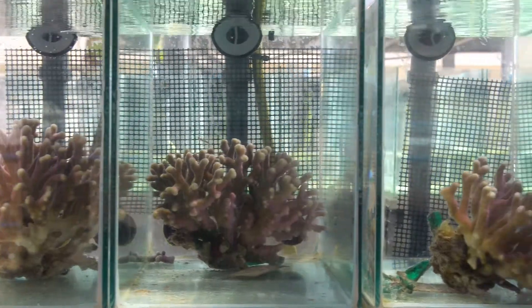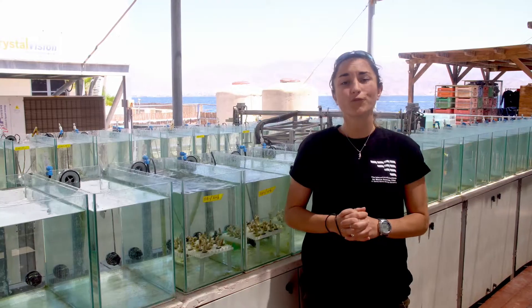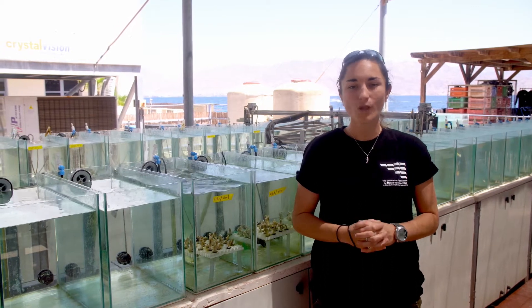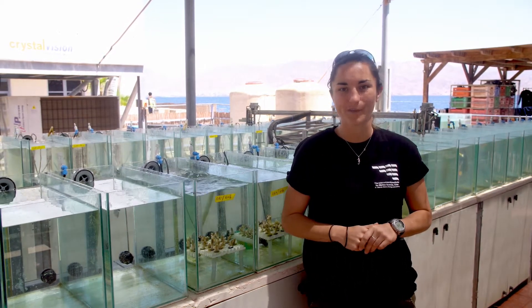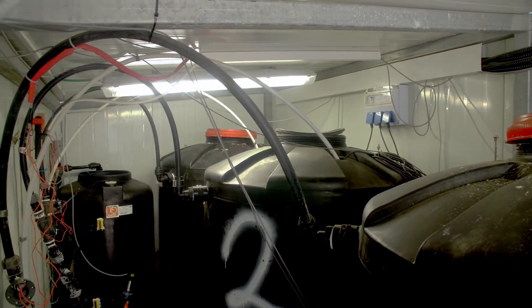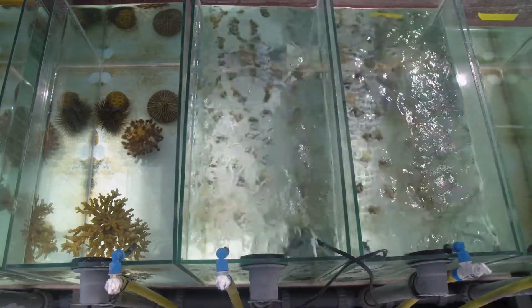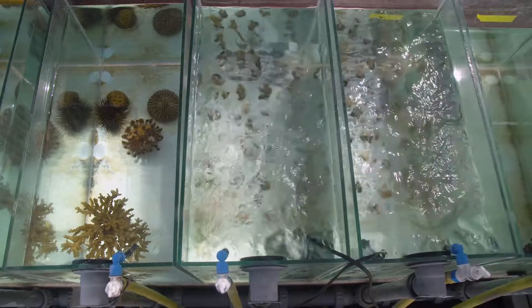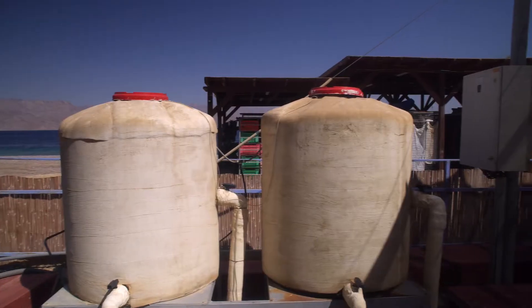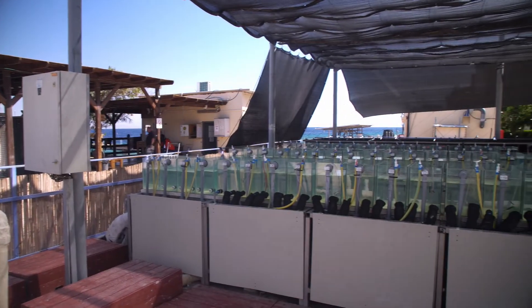In total, the system hosts 88 individually controlled experimental aquaria. Up to 4 pH treatments and 6 temperature treatments can be run in parallel. Water flows in directly from the adjacent Gulf of Aqaba and into one of four mixing tanks, where CO2 is bubbled in to adjust the pH to a desired value. Water then flows directly into the experimental aquaria where the corals are held. Water is pumped through a titanium heat exchanger where it flows counter-current to adjusted quantities of hot or cold fresh water, and in this way the temperature is tightly manipulated.